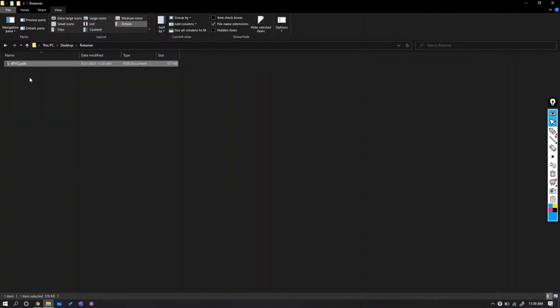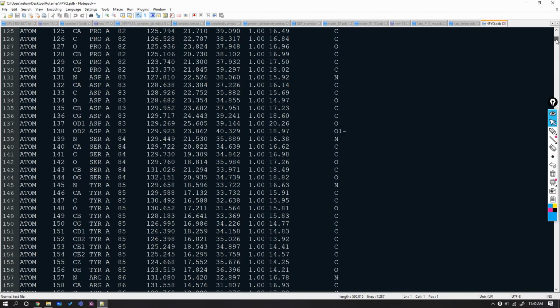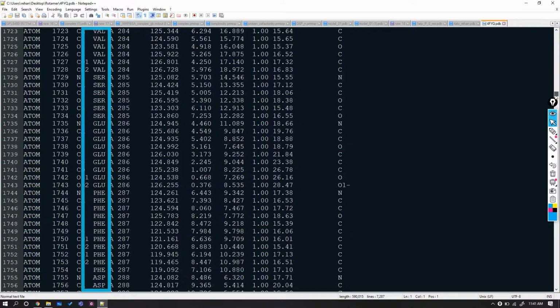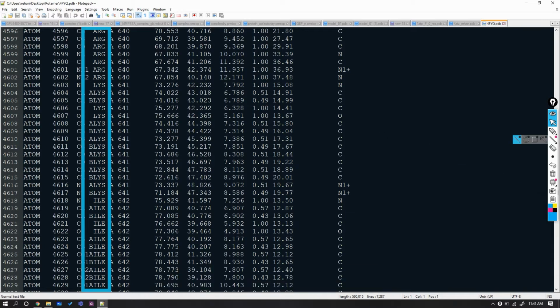Here's the downloaded file. Let's open it in Notepad++ by right clicking. After opening, let's scroll down from the very beginning and try to see the A and B in this column. I am fast forwarding the video from here as I am merely looking for the residues having A or B. Okay, after a little scroll and coming to the residue number 641, we can see A and B in this column. I want to emphasize that I left residue number 469 unintentionally due to the manual scrolling, and it is my mistake.